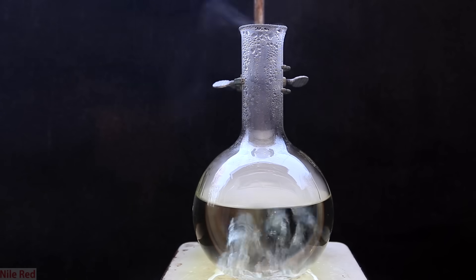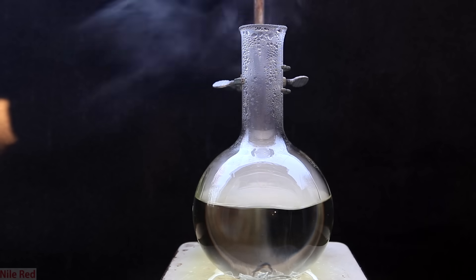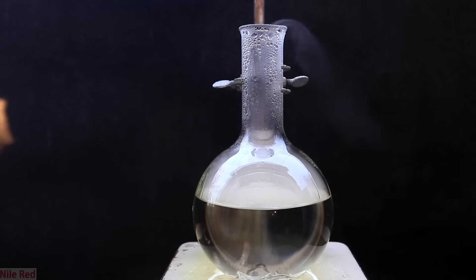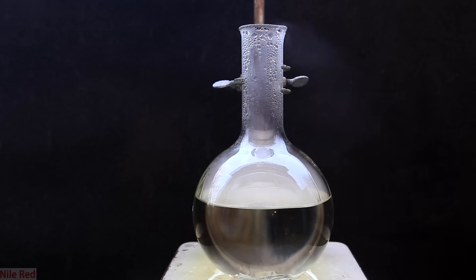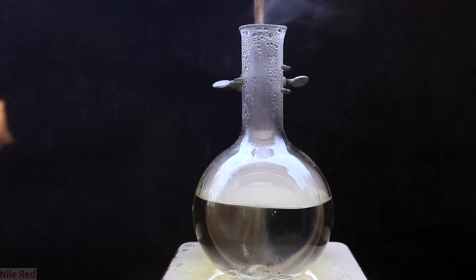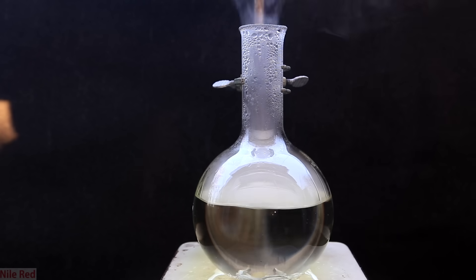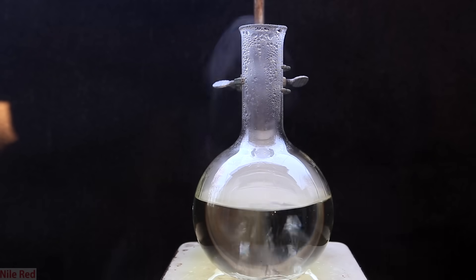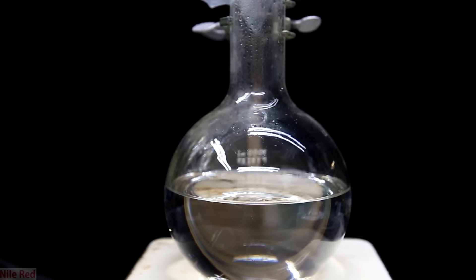It would not bubble very much, and then suddenly a lot of bubbles would come off. This can be dangerous because really hard bumping can lead to splashing, and in some cases it can also crack the glassware. After boiling for a while, the water should all be gone, and eventually we'll be boiling away azeotropic sulfuric acid, which is 98% sulfuric acid to 2% water. This endpoint is really hard to tell — it's kind of a judgment call — and once it's done, it's allowed to cool back to room temperature.